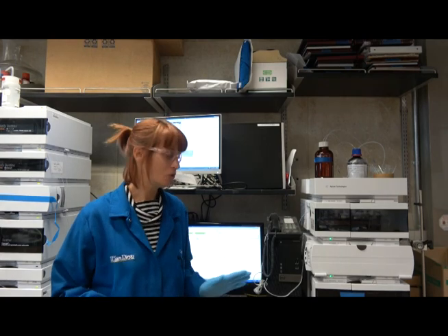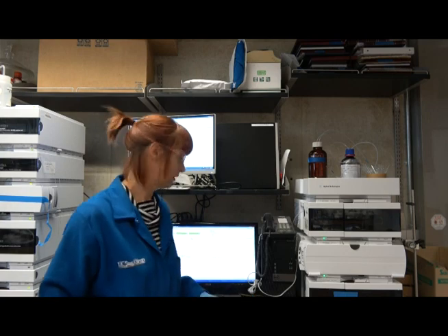All right, so now what we're going to do is I'll show you how to do an injection on the aqueous GPC. Almost everything is the same between the organic GPC or the chloroform and the aqueous GPC, except obviously the solvent and the type of polymer you can run.